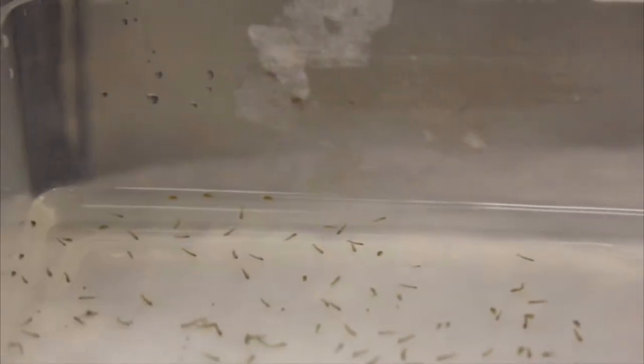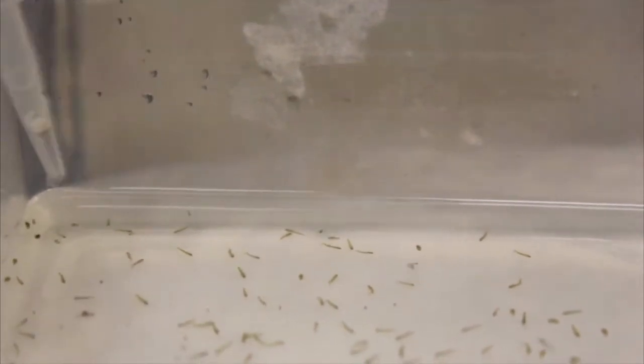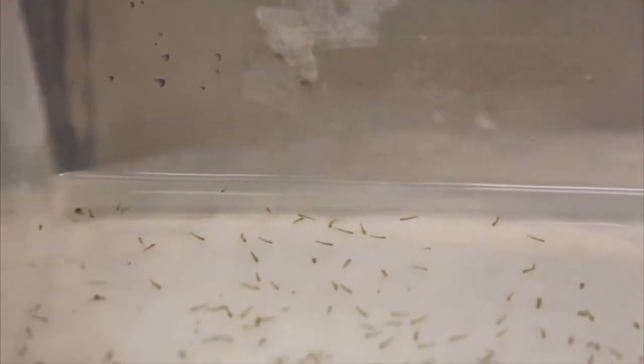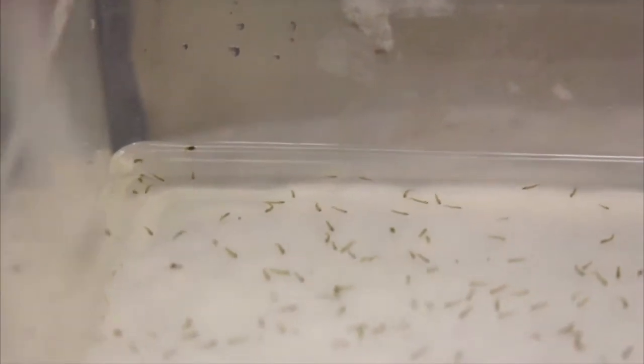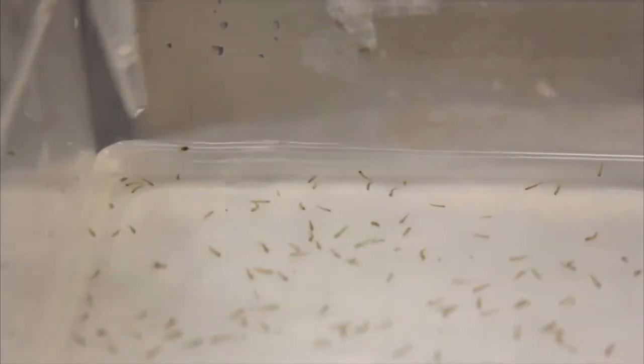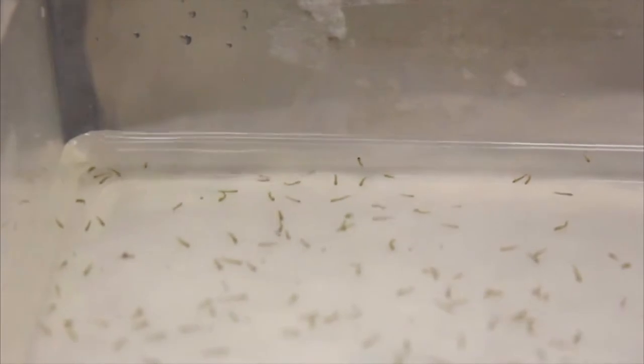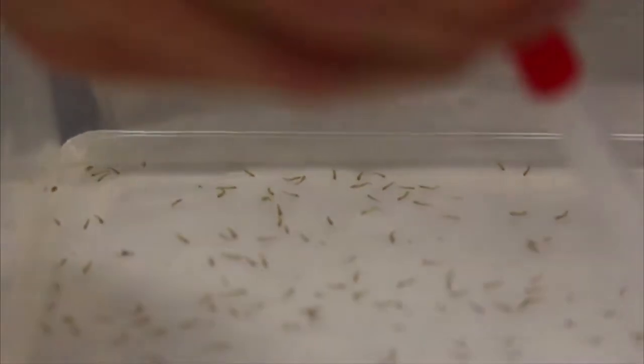Once the larva begin to pupate, pick the pupa using a cut pipette. If any pans have more than 50% pupa, they can be strained using a more efficient way to separate larva and pupa.